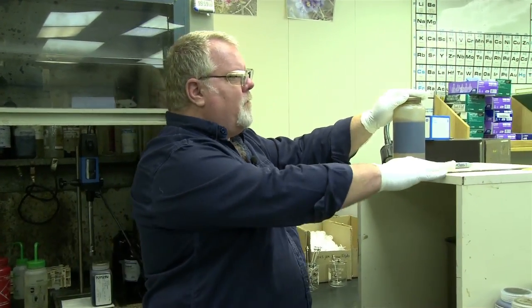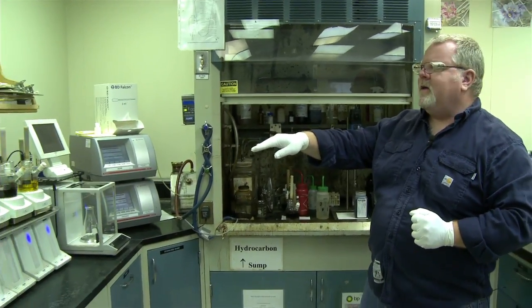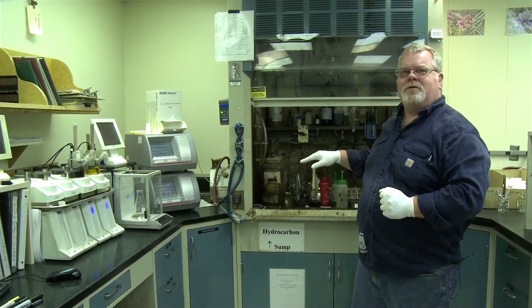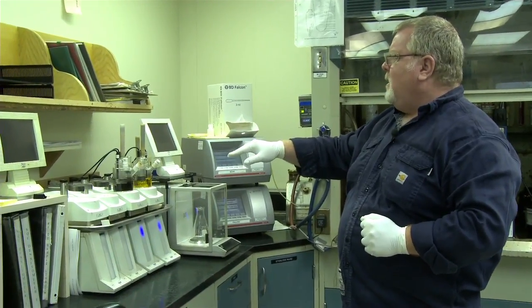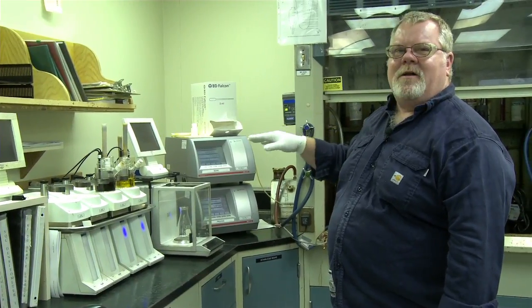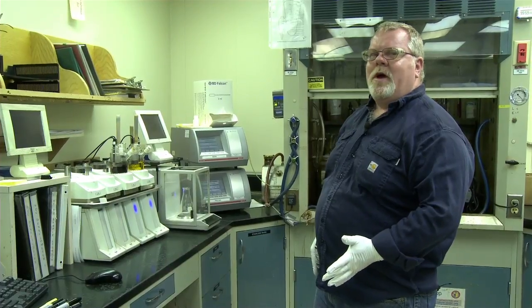So we'll do just a rough analysis with a ruler, take the percentage of that, that's the bulk water, and then on the Karl Fischer over here, it's very precise, and I'll add a small amount of oil to that instrument, and then it will do its thing and spit out how much water's in the crude, and then essentially we add the two numbers together. Two types of water cuts that we do, we call them wet and dry.